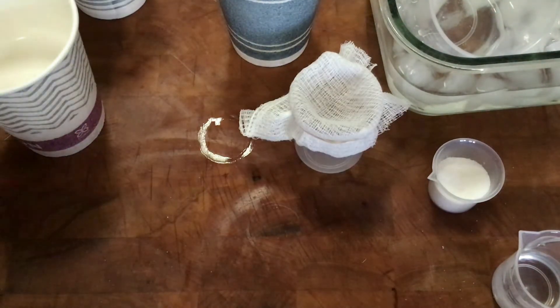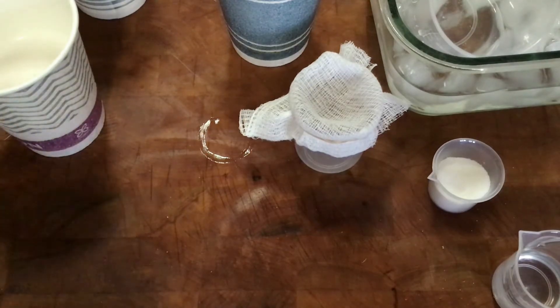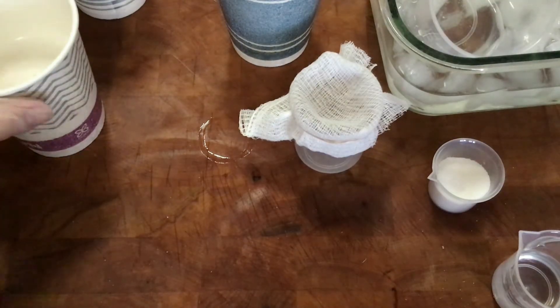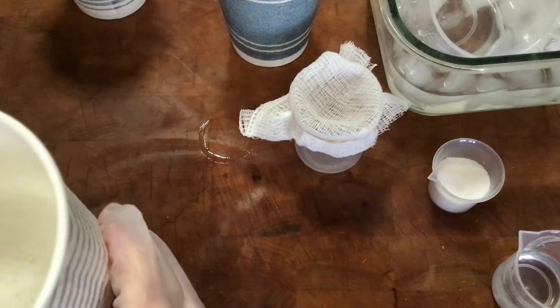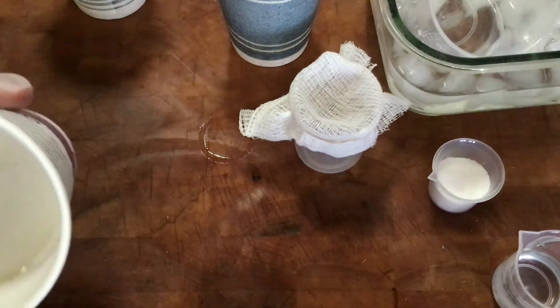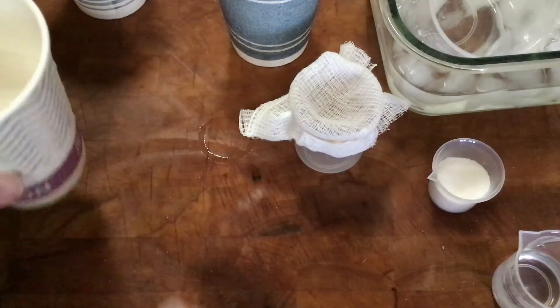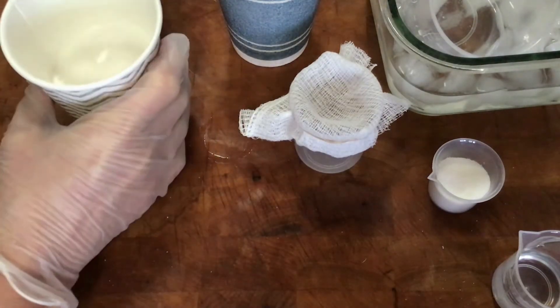The next thing students will wonder is: what if it's a different molecule? What if it's just the protein in fish muscle, beef muscle, or whatever that's resulting in the substance we get at the end of the protocol? So in the next demo, you take some protein powder — just plain protein powder mixed with water, a serving's worth as directed. Mix it up, stir it, and then we're going to do the same protocol.